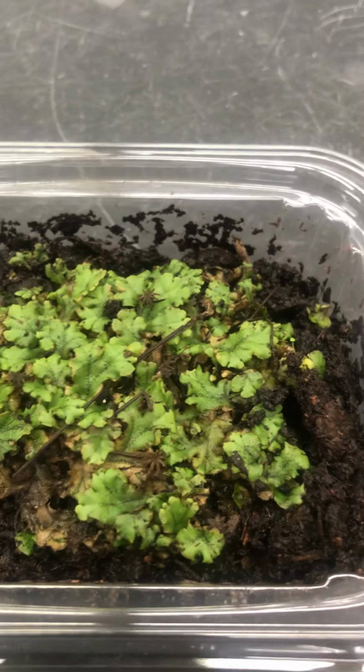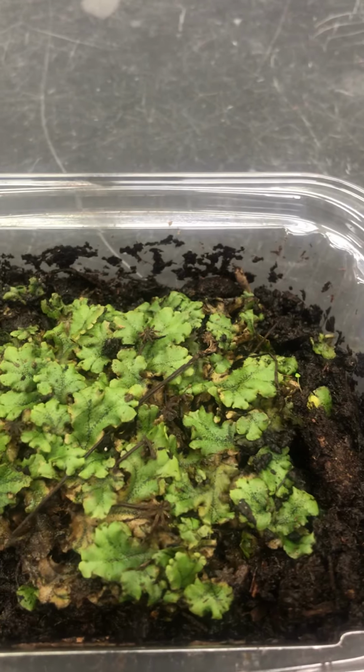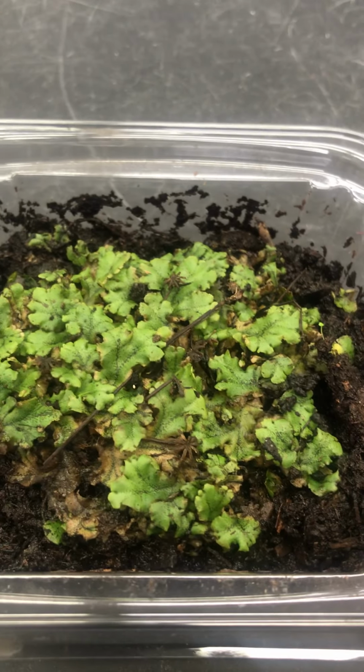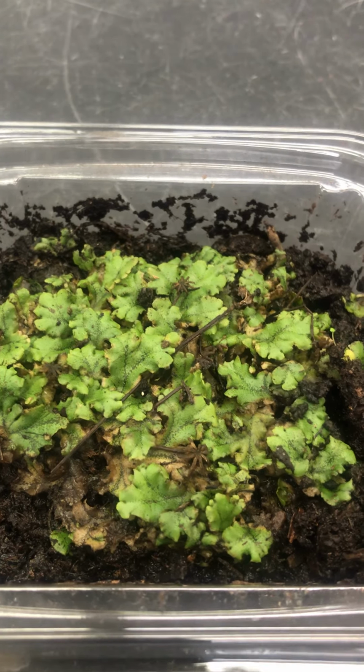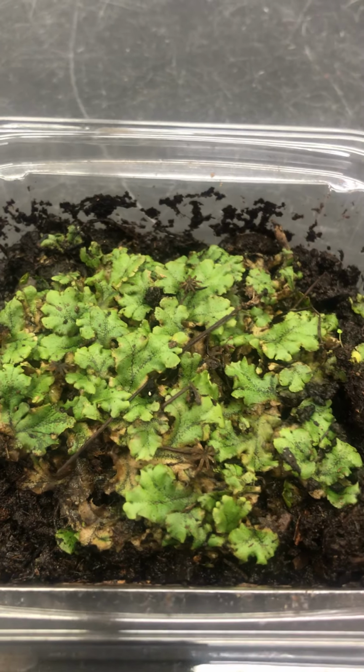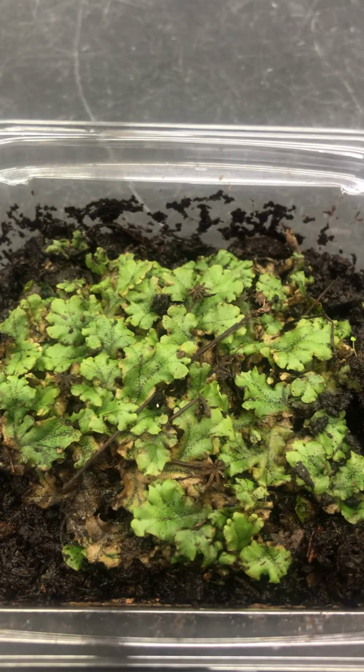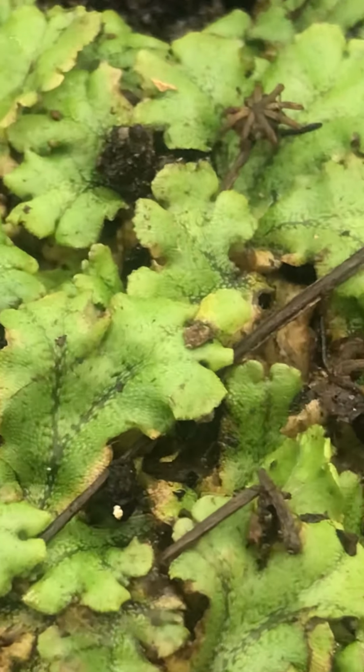Okay, we'll start off with a specimen of what's called Marchantia. Marchantia is a liverwort, and if you remember, the liverworts are in the phylum Hepaticophyta. So if you notice the growth pattern of this organism, very flattened, leaf-like. They're not true leaf structures. You can actually see there's lots of pores on them.